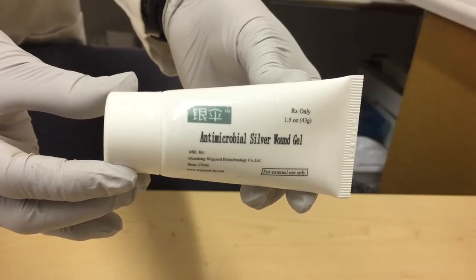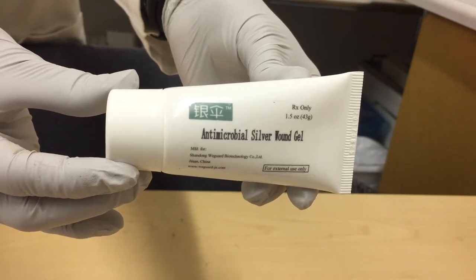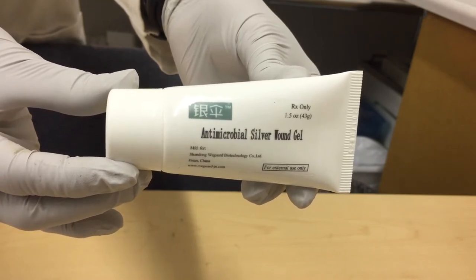This is a tube for antimicrobial silver wound gel from Medical Technology Research, a startup based in Woodburn, Oregon.